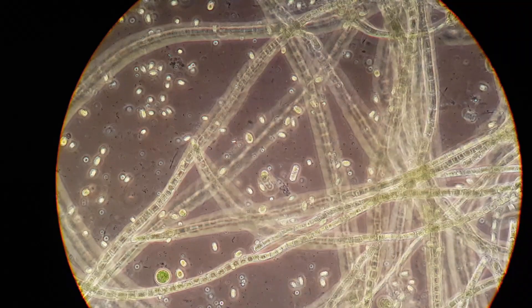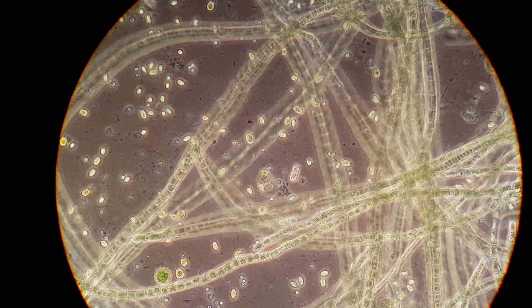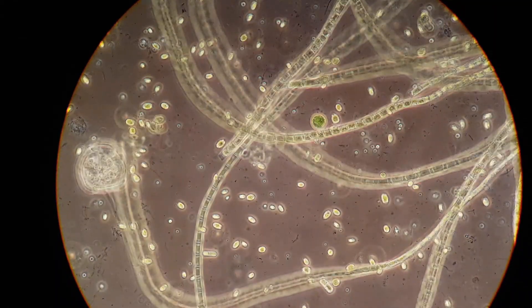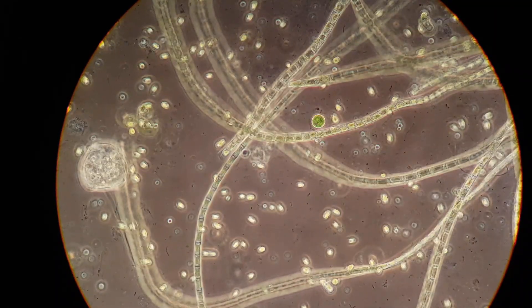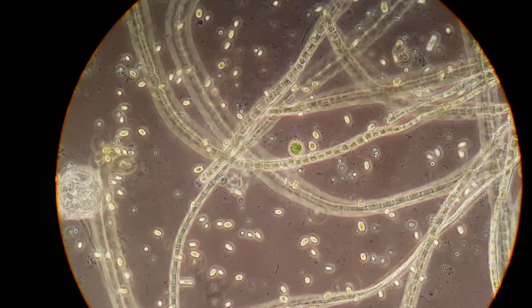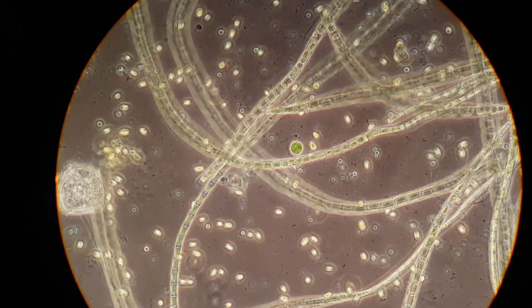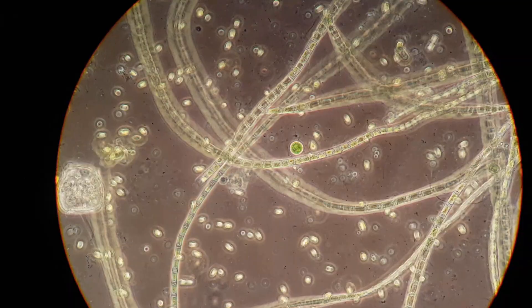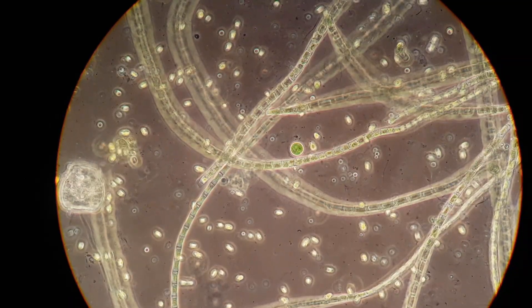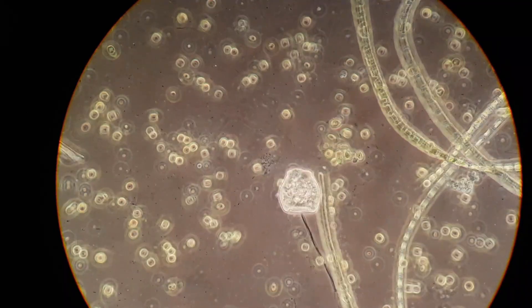This is a microscopic view of the life present in this community. These are large strings of cyanobacteria, many unicellular algae. We can see some bacteria zooming around and there are even protozoans present, like this Vorticella over here. All this after just two and a half months.